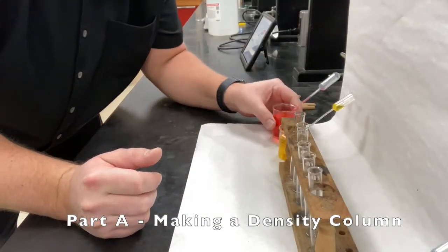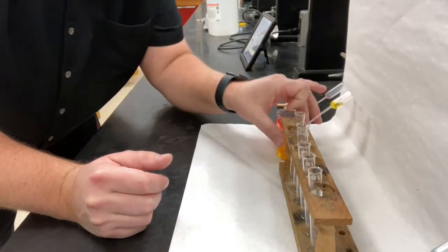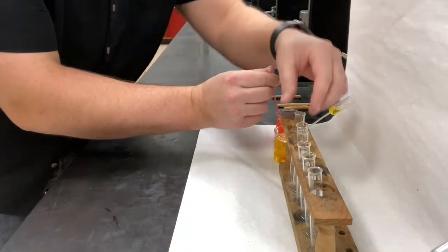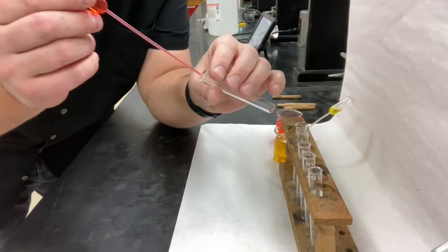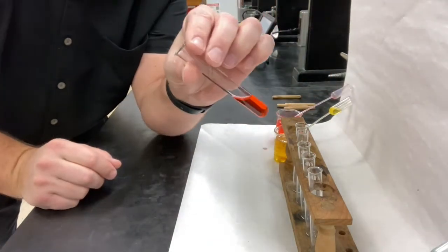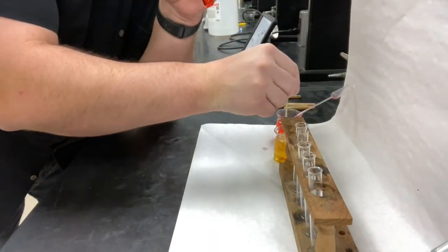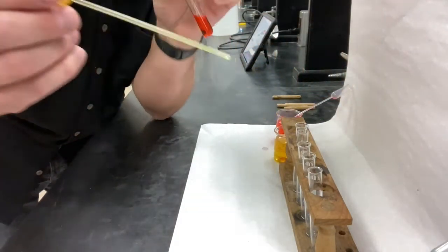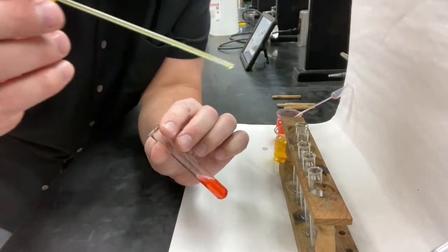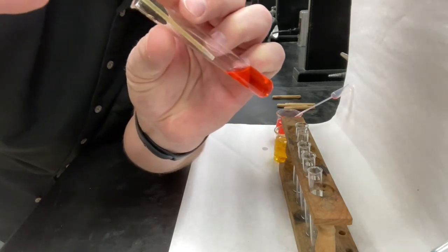Okay, so for our first mixture, I'm going to put red with yellow. So in your data table, go ahead and write down color 1 is red and color 2 is yellow. Now the first liquid, I'm going to squirt in there very quickly because there's nothing else. The second liquid though, I'm going to use this plastic pipette. Now you don't have plastic pipettes at home. We have them here at school, so later on in the lab when you have to do this at home, you might have to come up with a different type of substance.